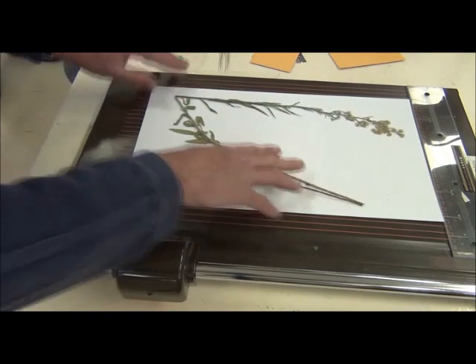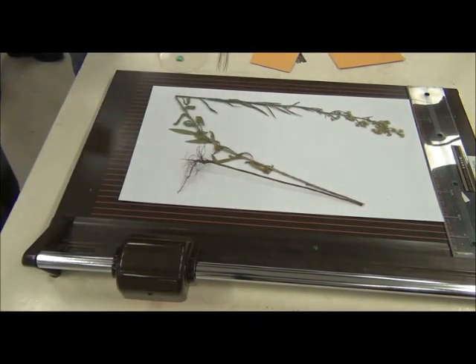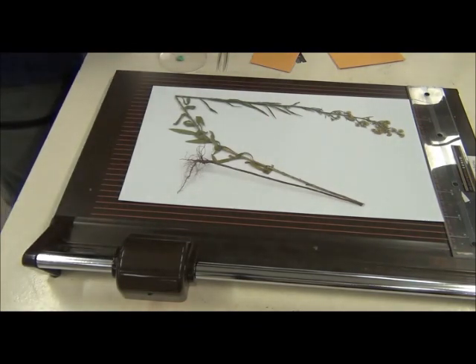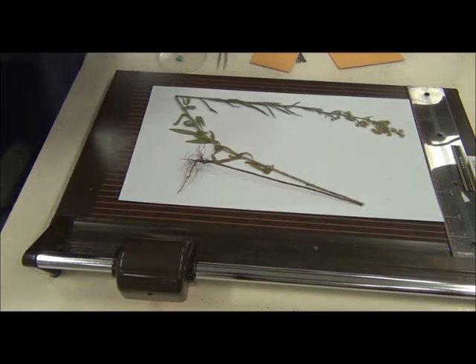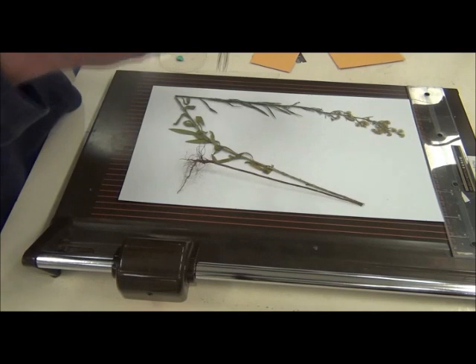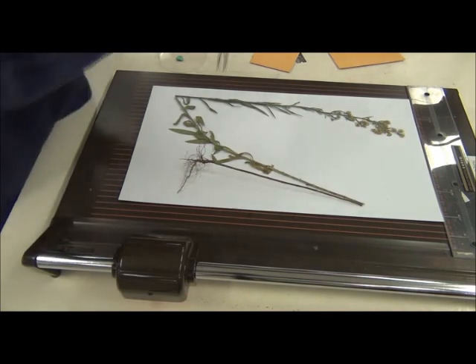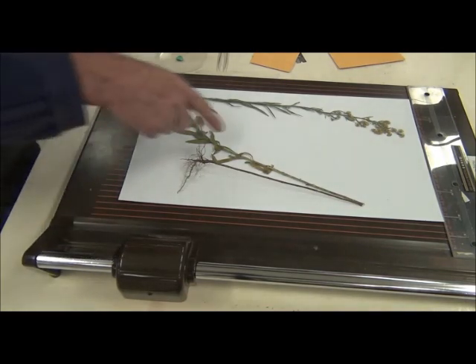So, the other thing you want to do is that if, for example, there was additional material that had to go into a cellophane bag, remember that the cellophane bag of whatever bits and pieces, you would also make a little label. It can be just from a little one or two centimeter square of A4 white paper and you put on that your initials and last name and your collecting number straight out of the collecting book.